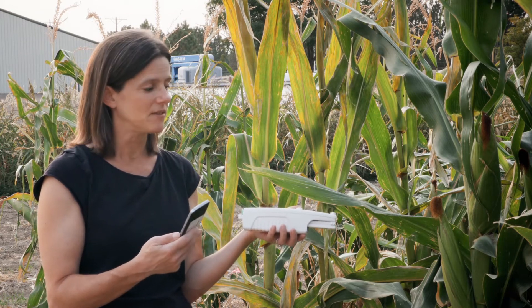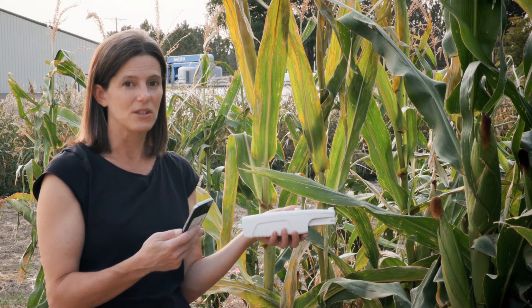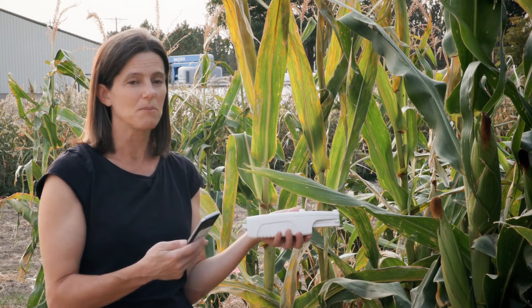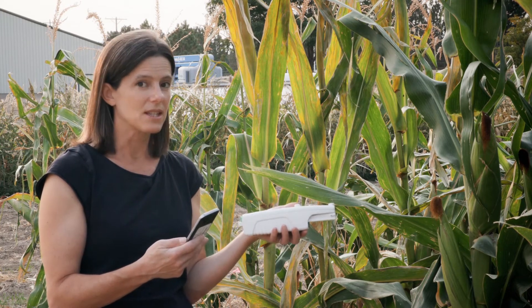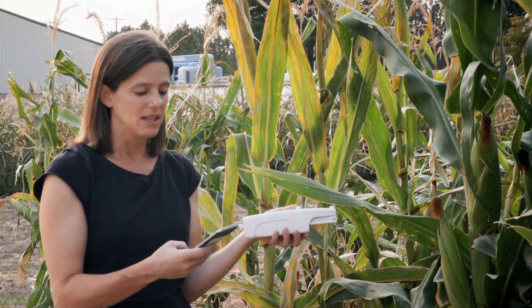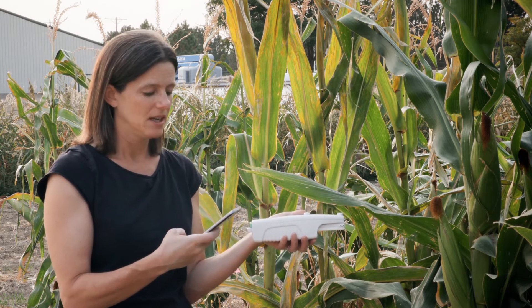For this lab activity, we are going to provide you with some field measurements using this instrument, and it is all connected via Bluetooth to an app on a phone.